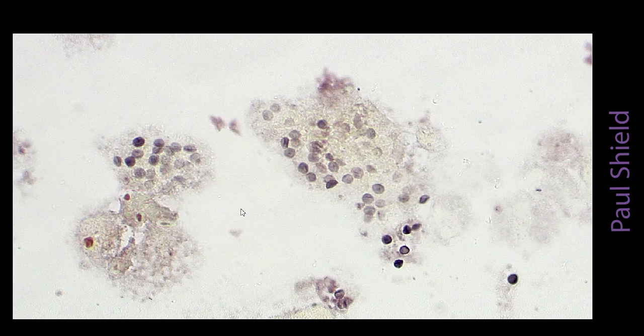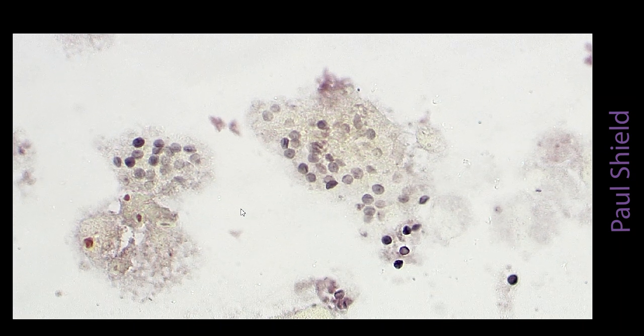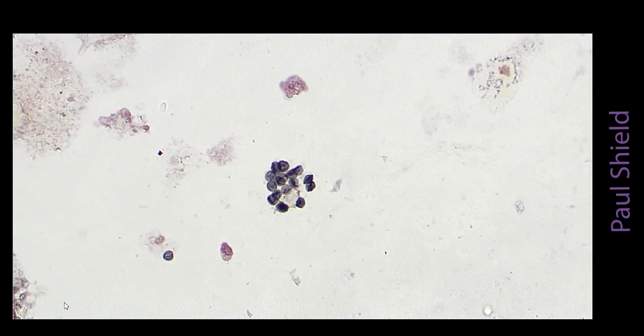Again, an opportunistic infection, commonly seen back in the days of the AIDS epidemic in Australia. Very hard to see with a pap stain. They stain negatively. So we used to use commonly a silver stain to highlight them.